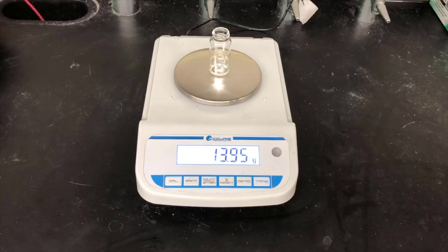We're going to use IR to look for the functional group changes, an OH group becoming a carbonyl. That's a big change that we'll be able to notice with the IR spectrometer.